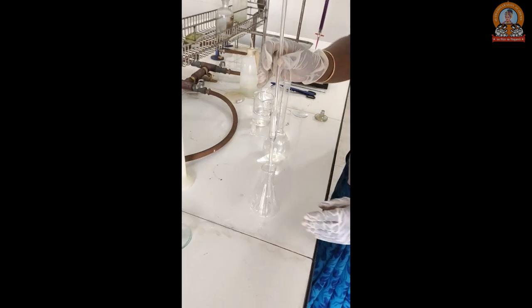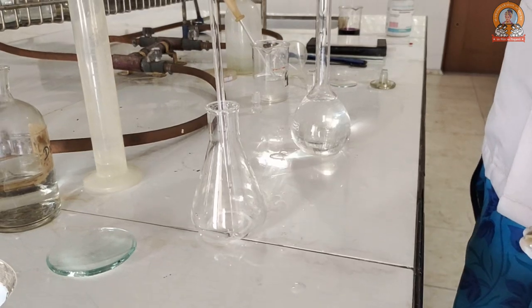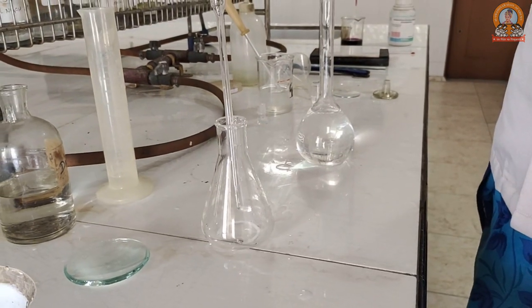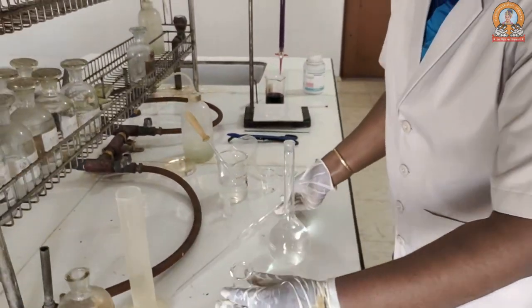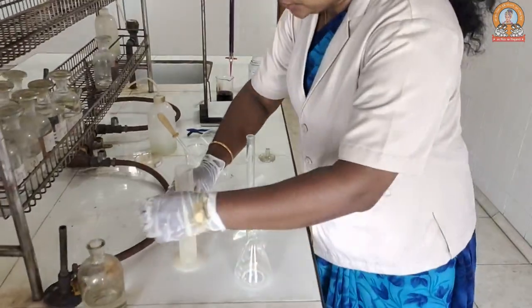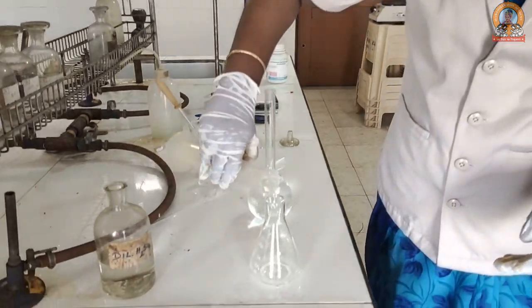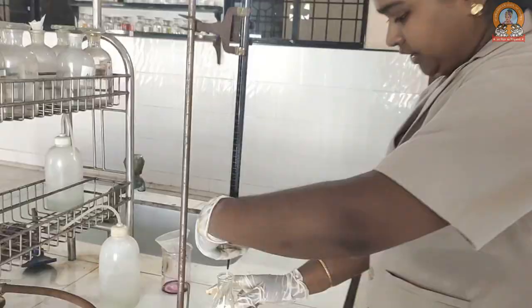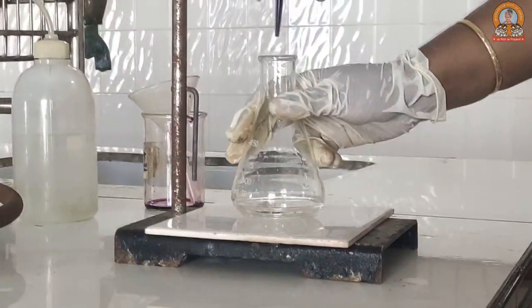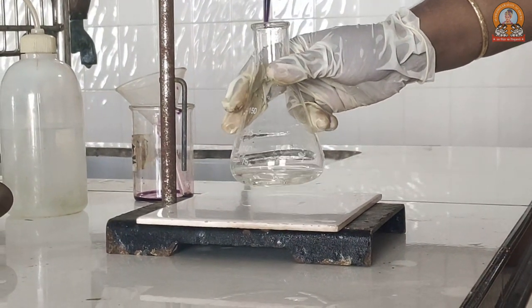Pour the solution into a conical flask and hit the pipette two to three times on the bottom so that the surface droplets are released. Now add 10 mL of dilute sulfuric acid into it — because our pipette was 10 mL, that's why we add an equal amount. Then pour the KMnO₄ solution from the burette until a permanent light pink coloration is achieved.